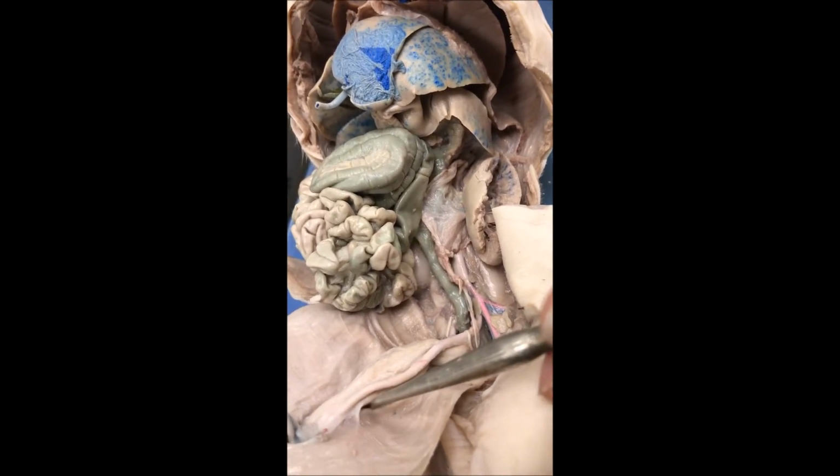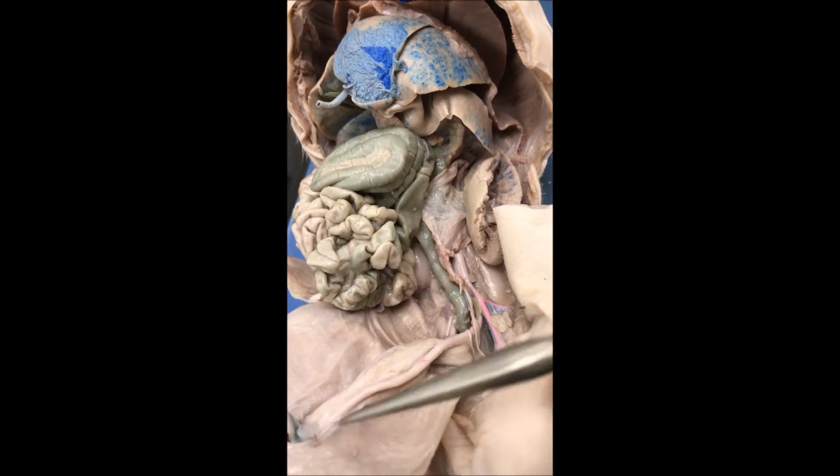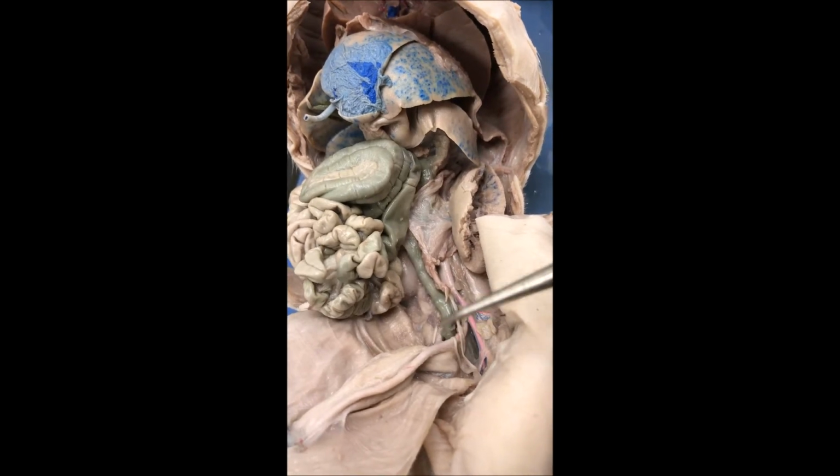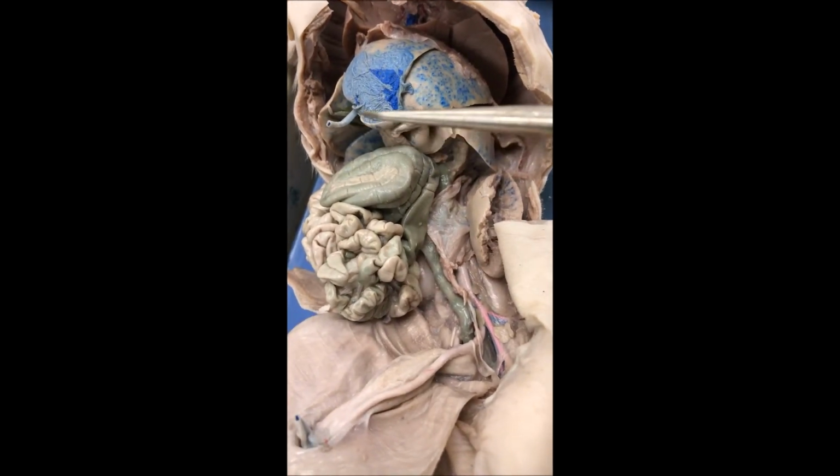This is the ductus deferens of the boy, which carries the sperm. And this little tube right through here is the penis of the boy. This would be the rectum that forms the solid waste material. This is the spleen that recycles red blood cells. And you have the umbilical vein, which you cut to open up the piggy.